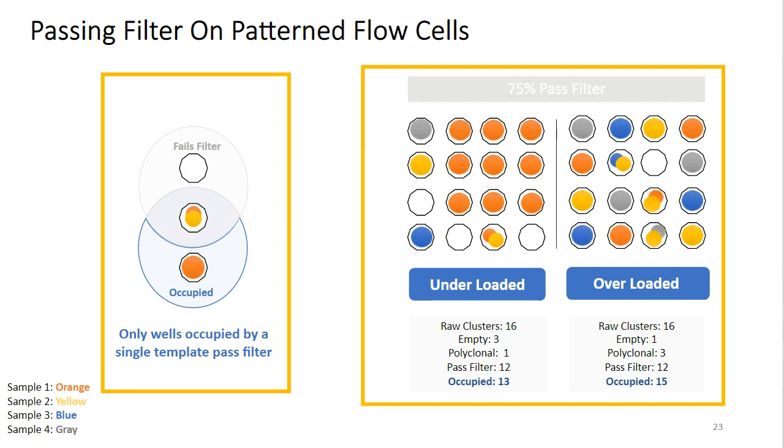Now in the overloading scenario on the right, we can see that we have fewer wells that are unoccupied, and therefore we will have a higher percent occupancy. So in the condition on the left where we have underloaded, we'll have a few wells that are unoccupied and therefore will show as empty wells. In the condition on the right where it's overloaded, we have very few wells that are unoccupied and our percent occupancy will be very high.